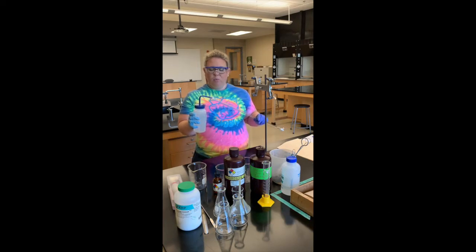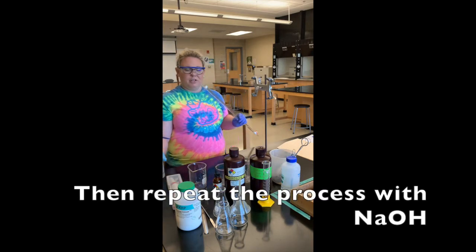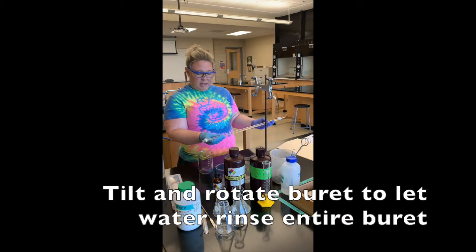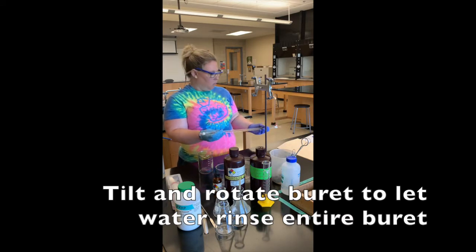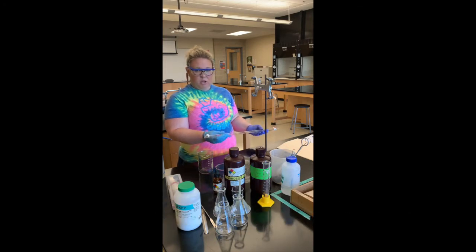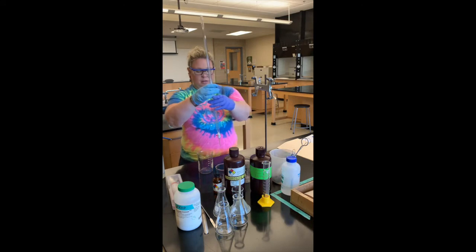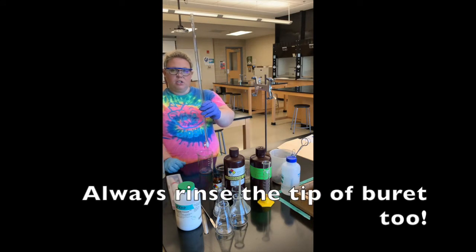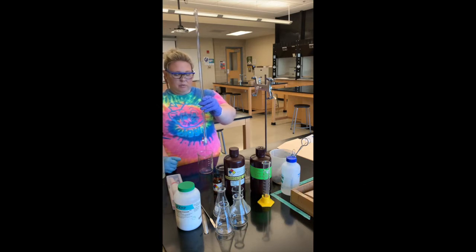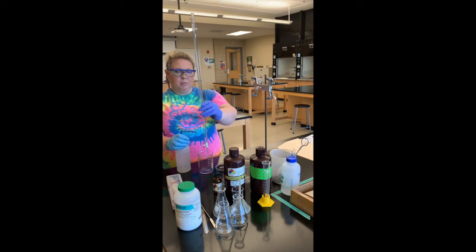Once we do the water rinse, you're going to do the same process with the sodium hydroxide or whatever you're titrating with. I'm going to take the burette, tilt it, and rotate it around so that the water touches all parts of the burette to clean it. Notice that I'm doing this over a beaker, so if I pour a little out it's okay — that goes into the waste container. Also, with all those washes, make sure you put the liquid through the tip of the burette because stuff can get stuck in there as well. We'll repeat that process four more times with distilled water.